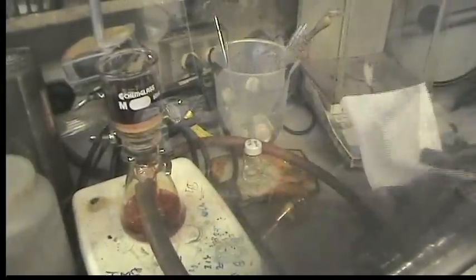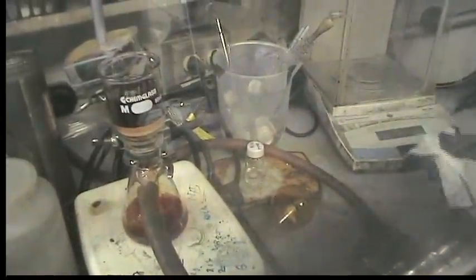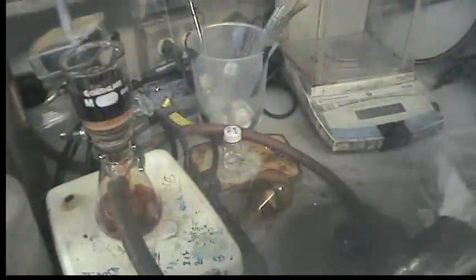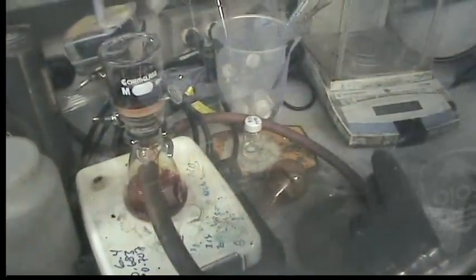While this filters, I can show you what some isolated solids look like. So we make this compound on very large scales, so we have a lot around. You can see it's a really bright orange color. Here we're going to isolate the Dichloride as the THF adduct, but it looks pretty much identical.